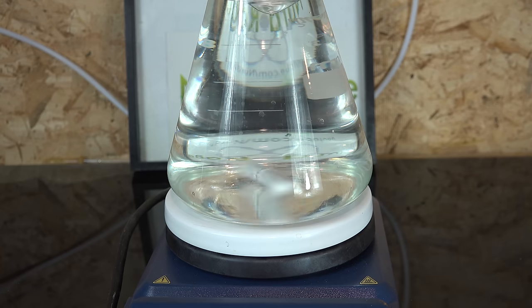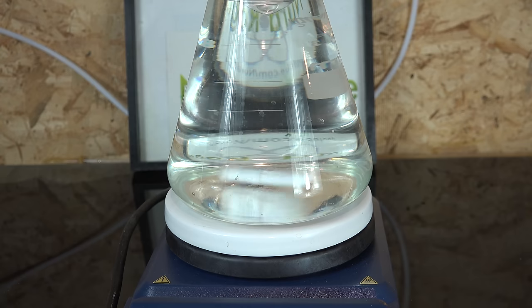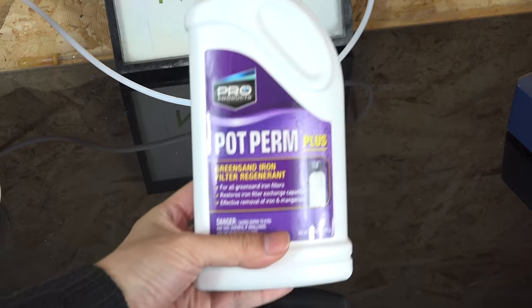It's much easier to get and pure enough for our purposes. Don't worry about the precision of our quantities, we just need an acidic solution. I'm actually using an excess. Once all that's dissolved set it aside.